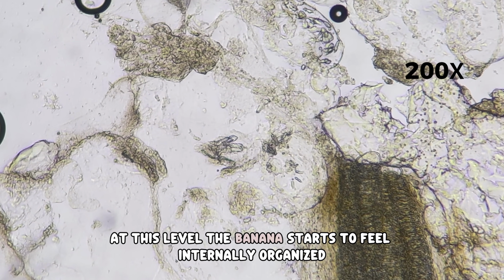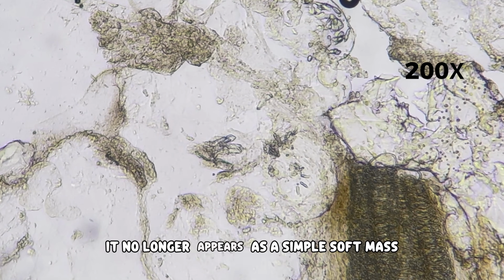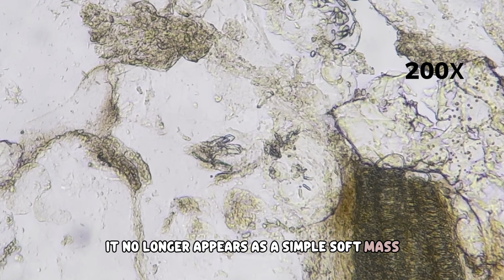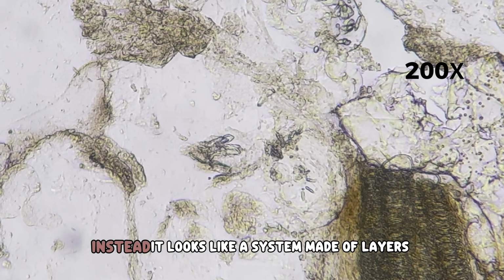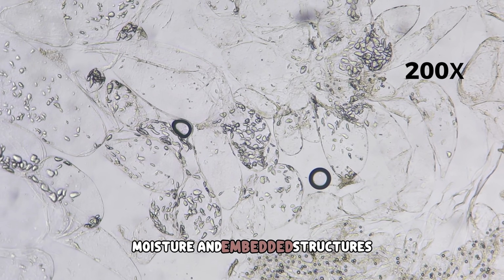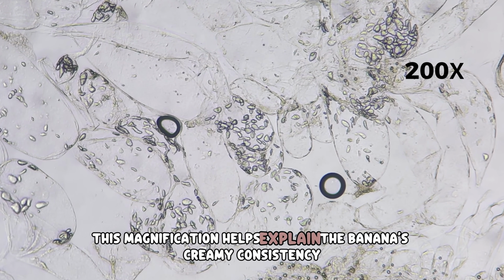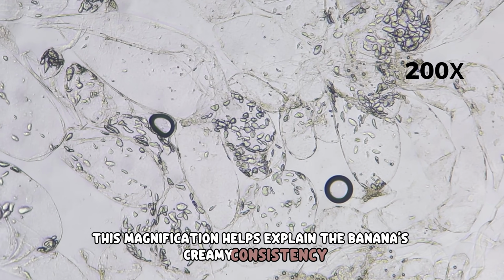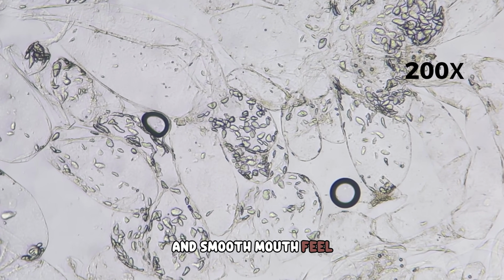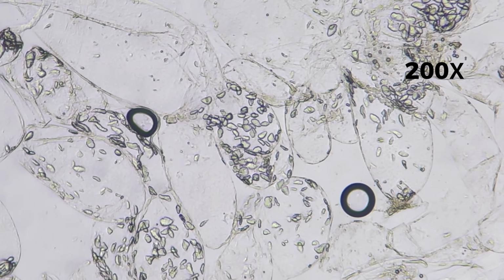At this level, the banana starts to feel internally organized. It no longer appears as a simple soft mass. Instead, it looks like a system made of layers, moisture, and embedded structures. This magnification helps explain the banana's creamy consistency and smooth mouthfeel. Softness and structure begin to coexist visually.